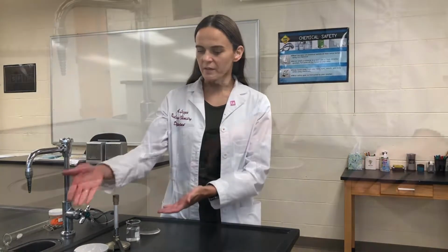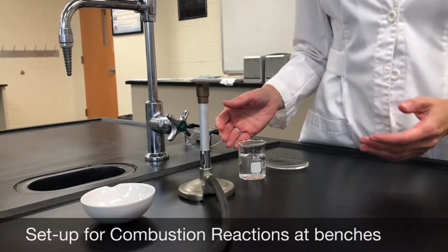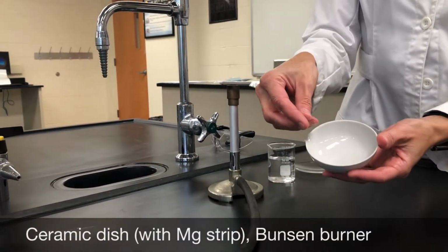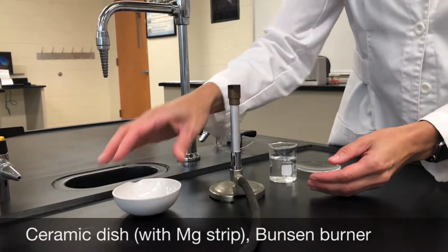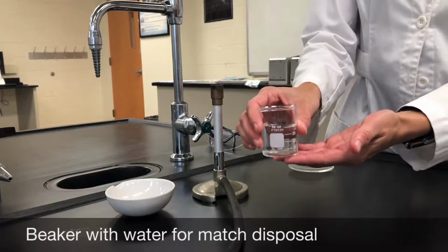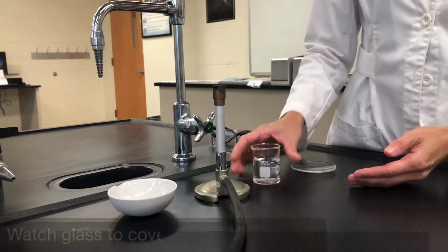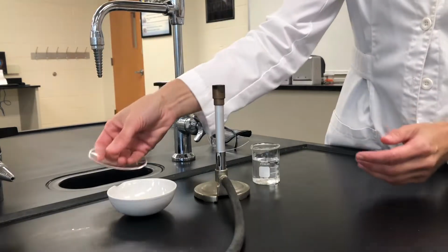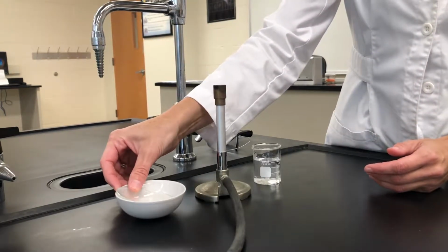In the lab, you will observe two different combustion reactions. So the setup will look something like this. So this is what you will be using for the combustion reactions. So you have your ceramic dish with the magnesium ribbon. You have your Bunsen burner, okay? A beaker with water. So this is where you put your matches once you're done using them. And then a watch glass that will be used to cover a flame. So you can put the watch glass like so.